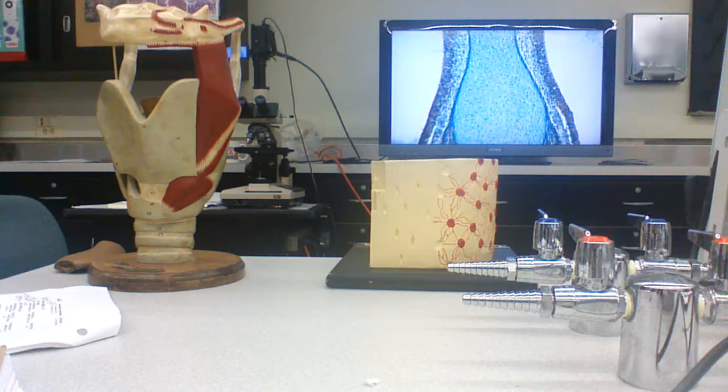And these osteogenic cells are basically going to go in here, and they're going to start depositing bone on the lacunae where the cartilage cells used to be. And they're going to make a spongy bone. So this thing is going to continue growing. And eventually, you're going to have a bony collar.